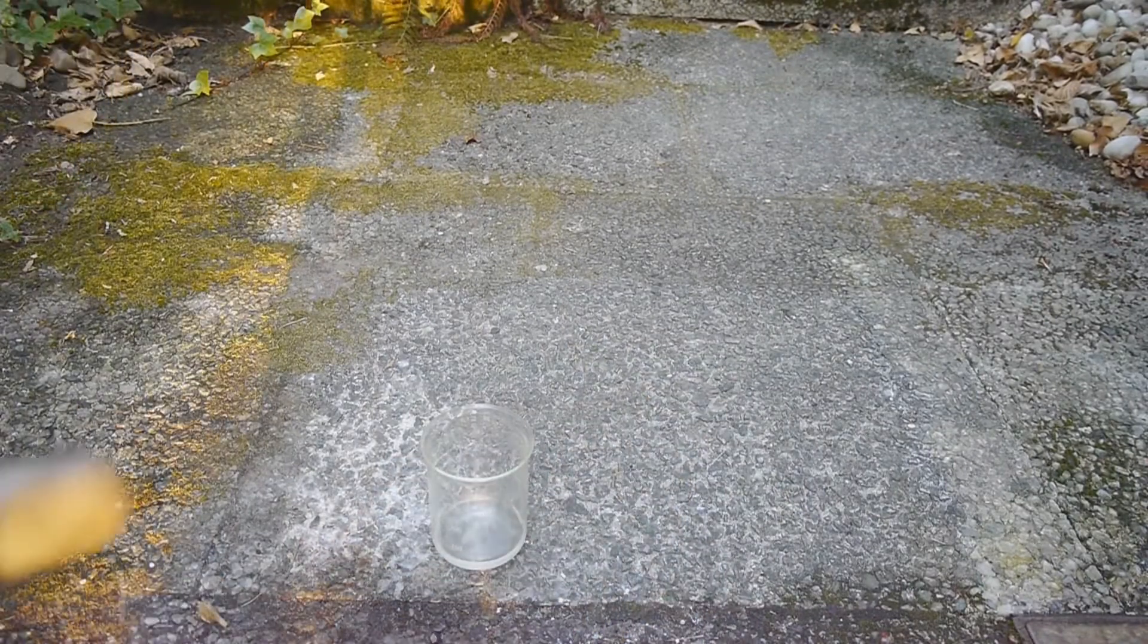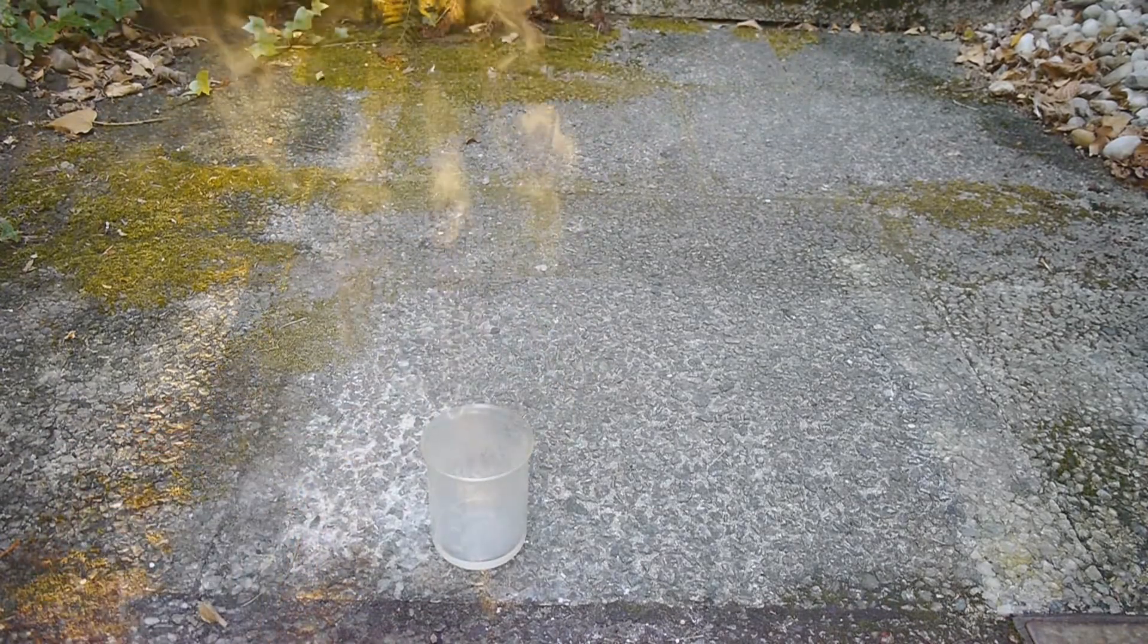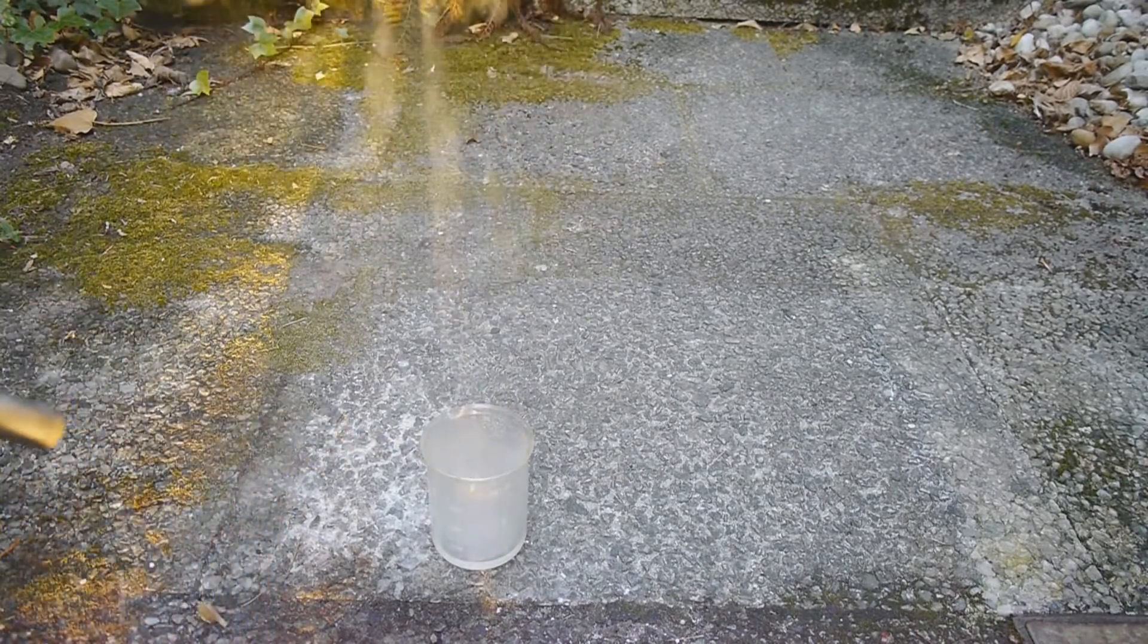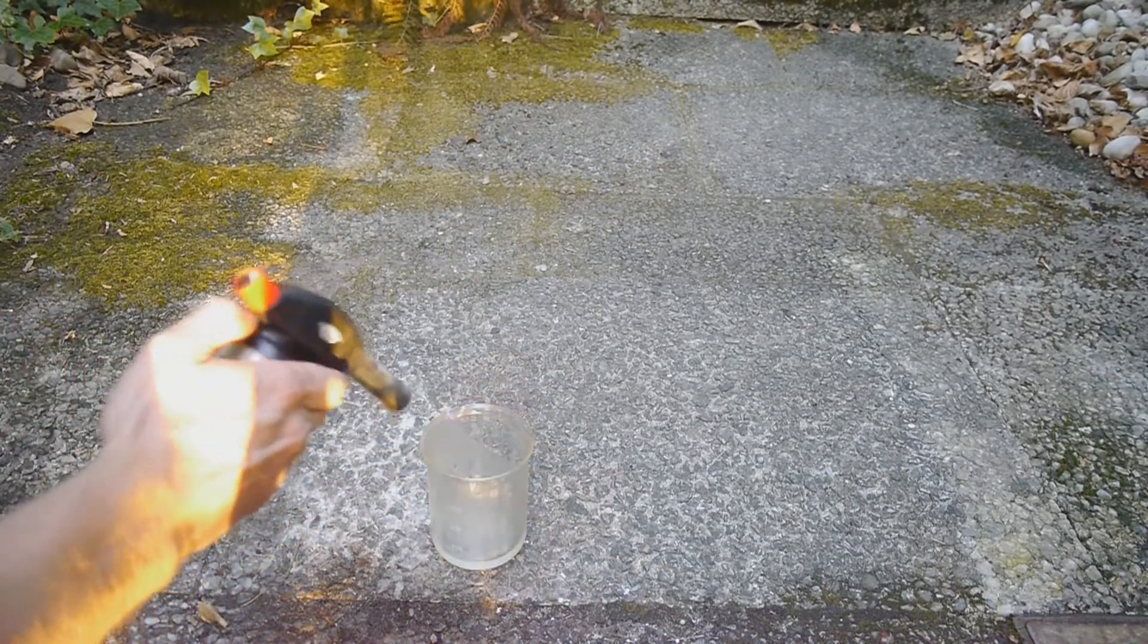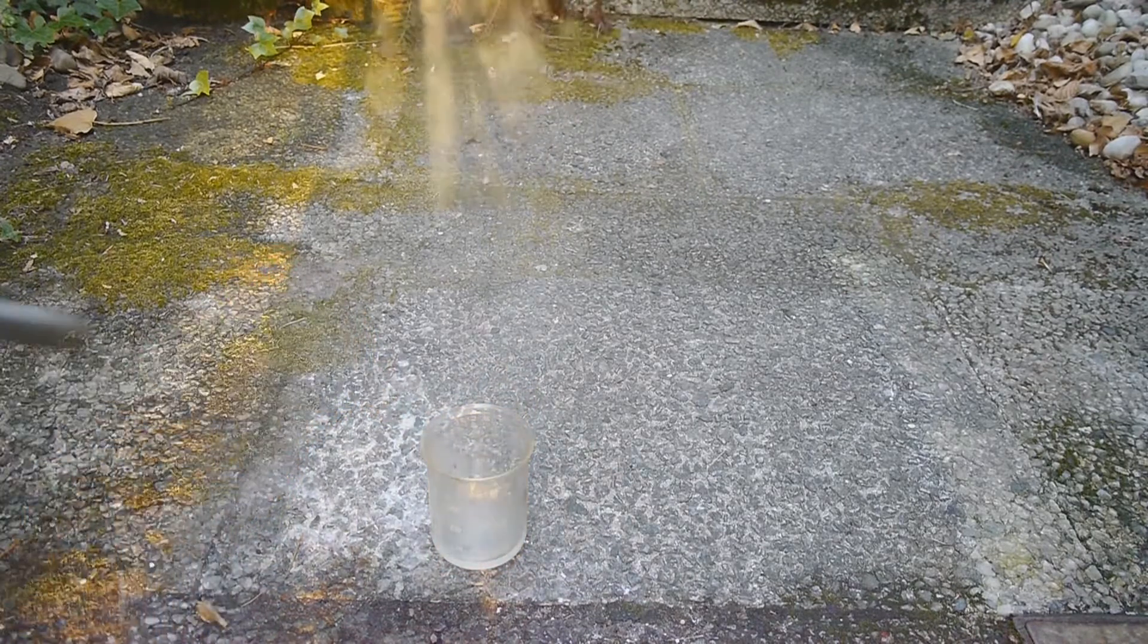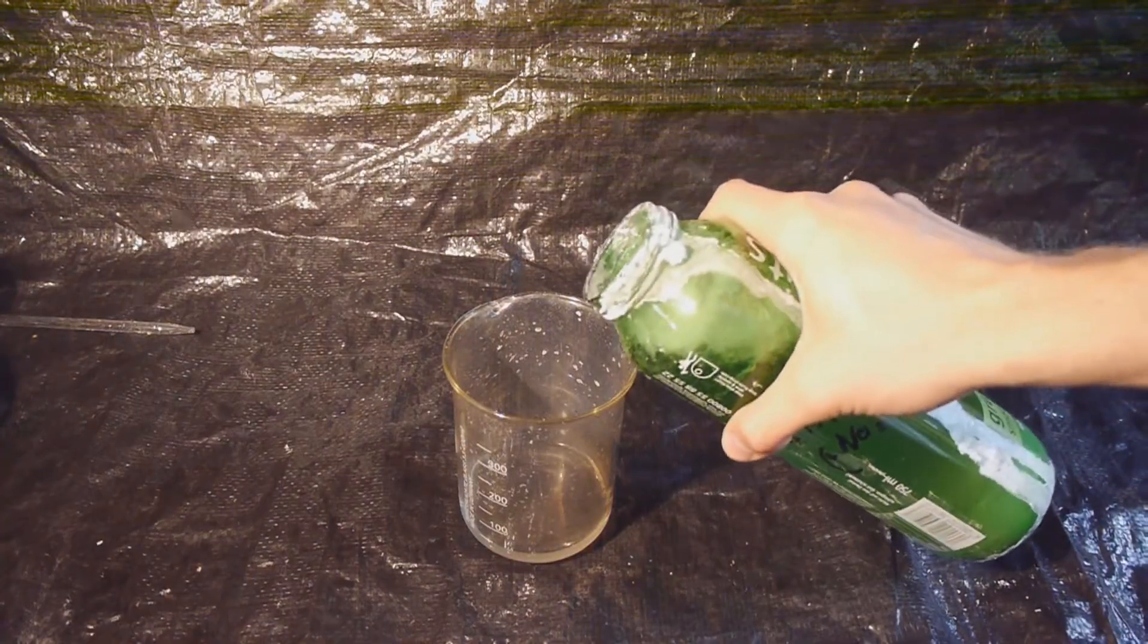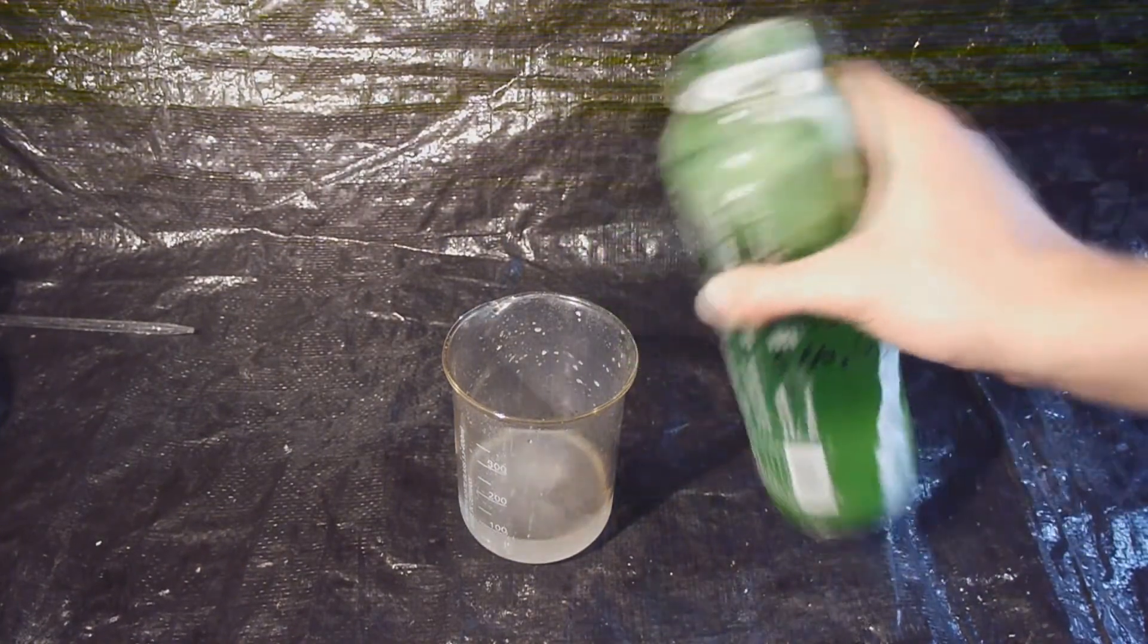Let's see how some of the highly contaminated residues from the first run are able to burn. Jesus Christ. This smokes profusely. The bromine seems to be a good flame retardant. I'll just add some concentrated sodium hydroxide so it will get destroyed overnight and now be done with it.